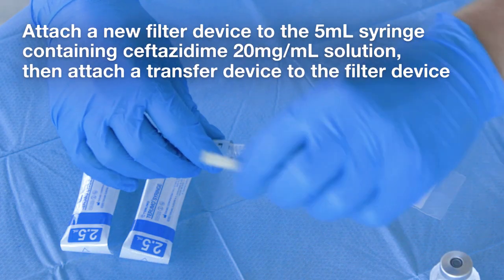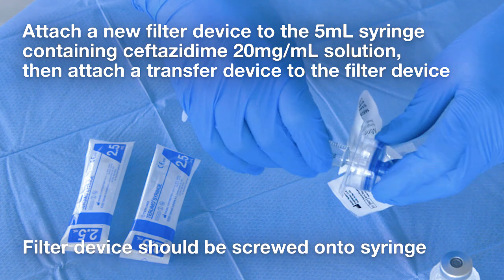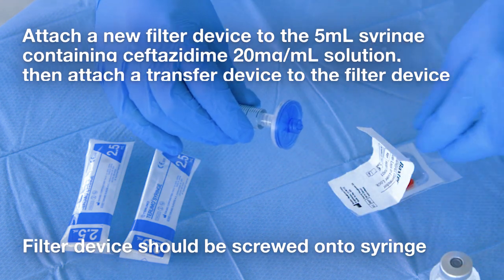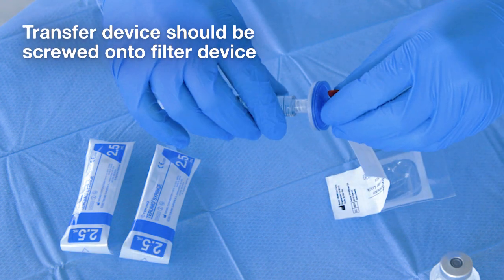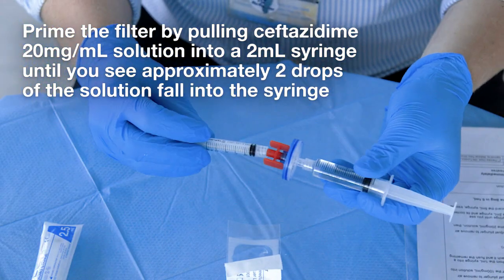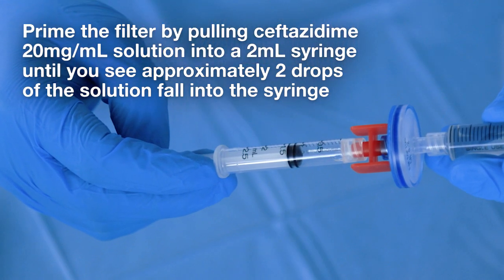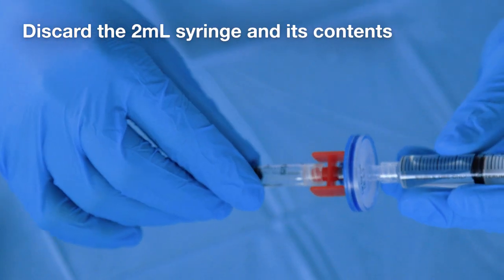Attach a new filter device to the 5 ml syringe containing ceftazidime 20 mg per ml solution, then attach a transfer device to the filter device. Filter device should be screwed onto syringe. Transfer device should be screwed onto filter device. Prime the filter by pulling ceftazidime 20 mg per ml solution into a 2 ml syringe until you see approximately 2 drops of the solution fall into the syringe. Discard the 2 ml syringe and its contents.